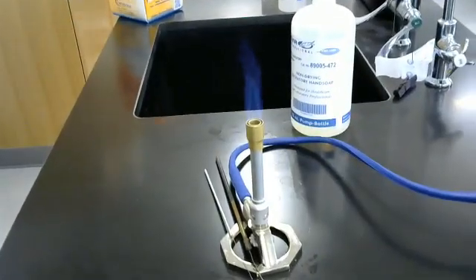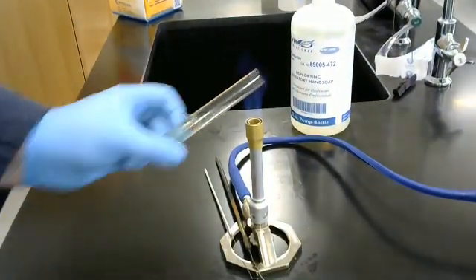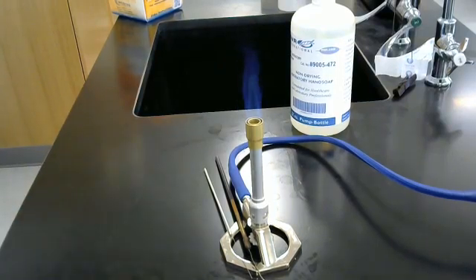Back to the fire for aseptic technique. One, two, three. Ready, cap it, and you're good to go.